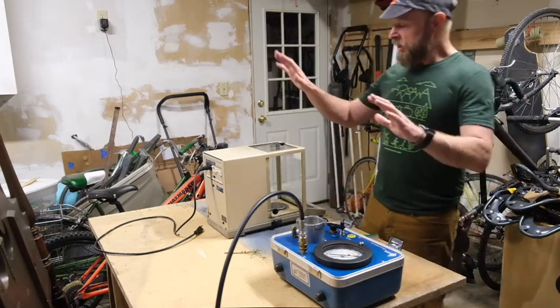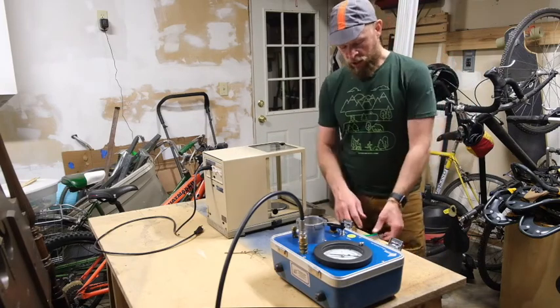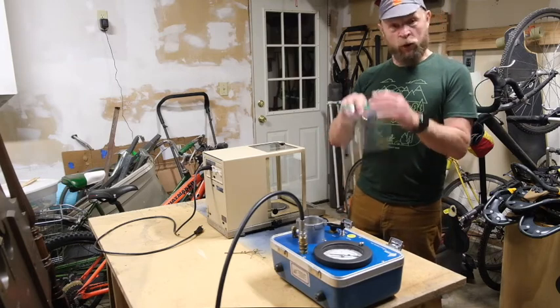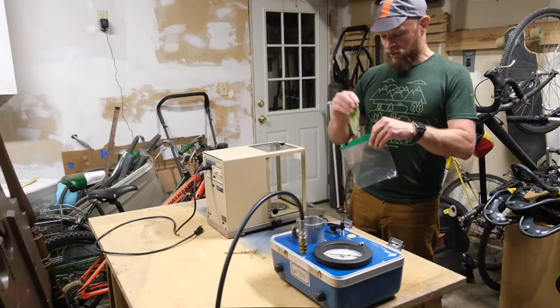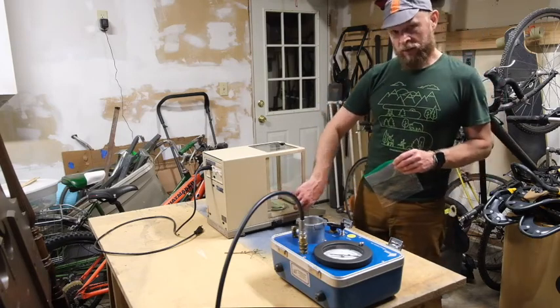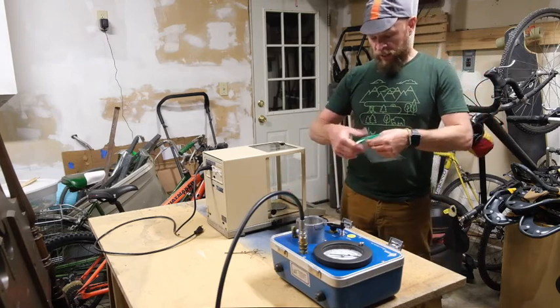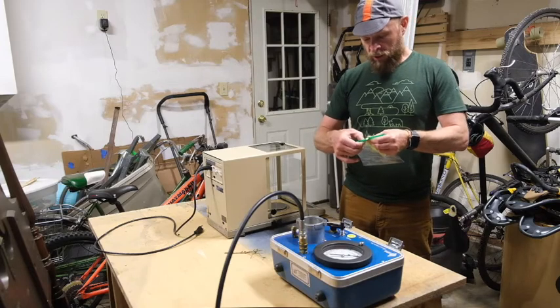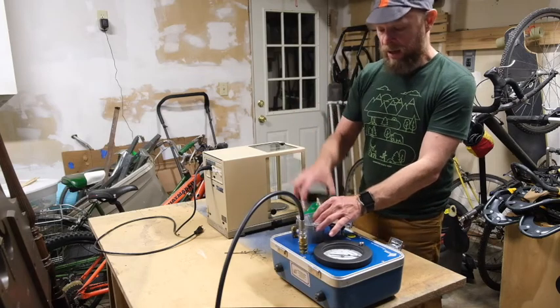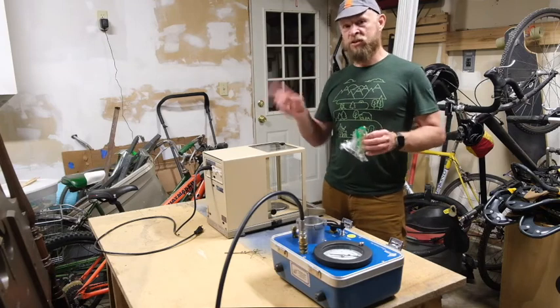So let's pretend I measured the weight and the water potential of that leaf at full hydration. And then I set it on the bench like this for about 5 minutes. And knowing the species, I said, okay, 5 minutes is good. Before I put it in the bag, I'll go ahead and weigh it again, take the weight, then, as quickly as I can while still being careful, put it back in the bag, put it in the chamber with the chamber head on, and measure a water potential again. I would continue that over and over again.